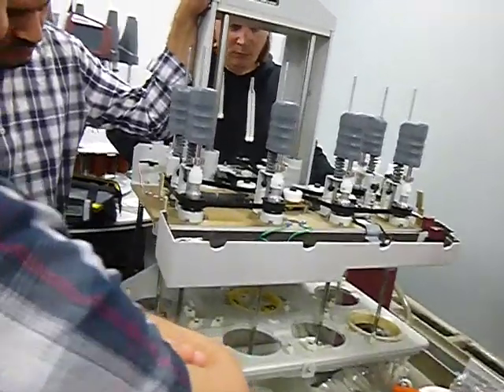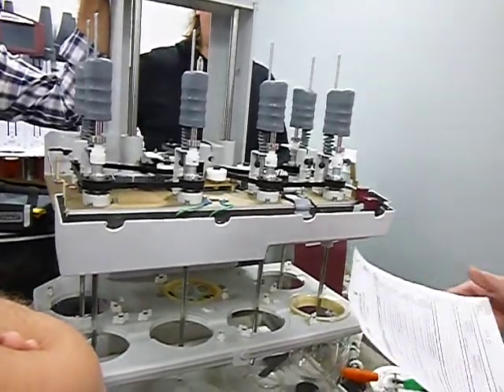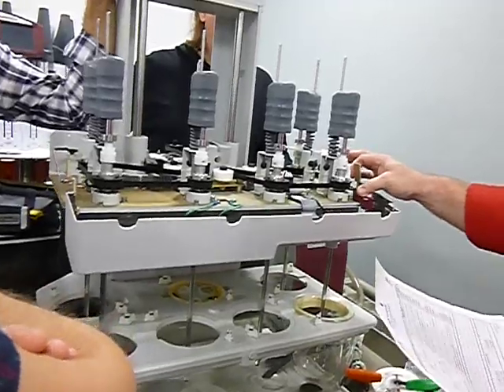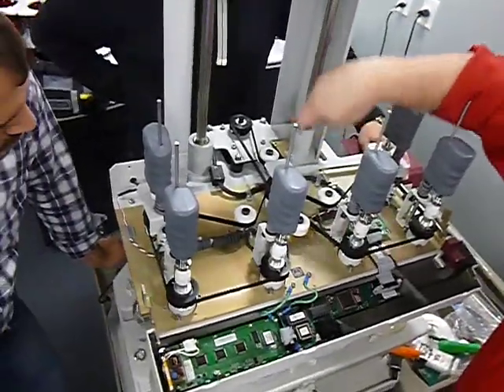Belt lubrication we talked about, lubrication of the bearing, the idle wheels, the spindles. You can do all that. Again, 3-in-1 oil is what typically we use. Inspection of the release lock, which we talked about, the inspection of this to make sure that it works, if you need to adjust it. This is fine adjustment right here. That's your big adjustments in the back behind there.